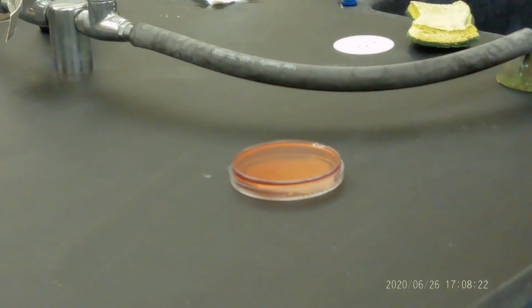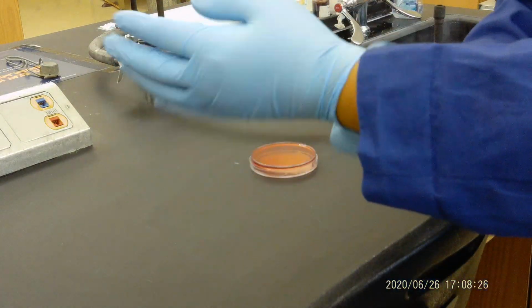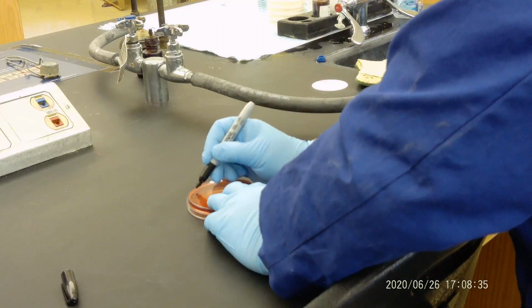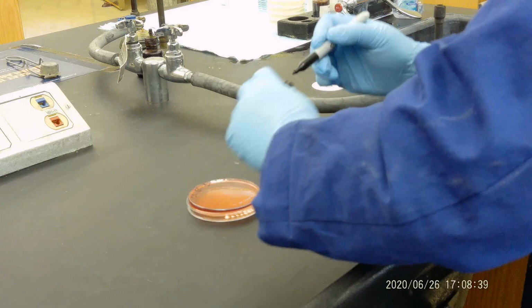You can do all of this by yourself. But sorry, I missed the Listeria monocytogenes, but we will be mentioning it again. Okay. So first of all, you're going to label. This is MacConkey agar. You want to label CS, EC, and the bench number. Let's say number 1.